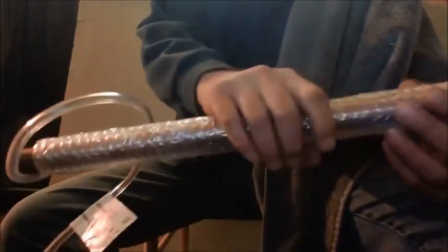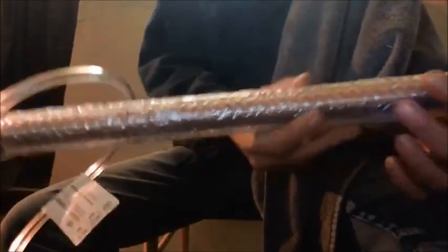So this time I got the same setup. The diameter of the tubing is bigger this time. Last time it was like the size of my finger. I use smaller diameter tubing because it was kinking up before. Plus I had two different sizes. This time I got to look how nice and uniform it is. Now at the end here, I got a brand new can. Now this still has seams. This is still not the correct way to do this. This is a terrible way to do this. I don't suggest anyone do this.